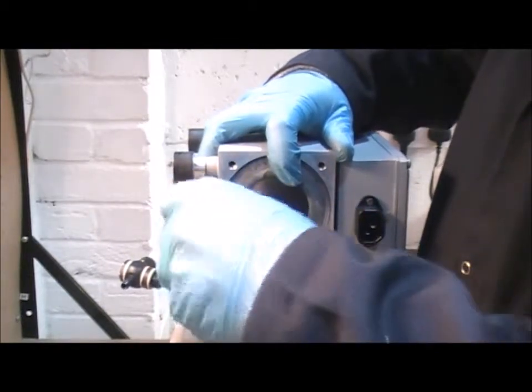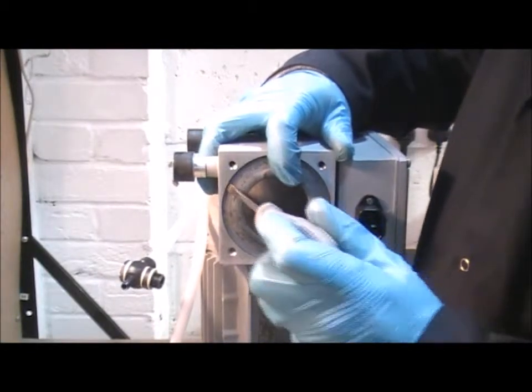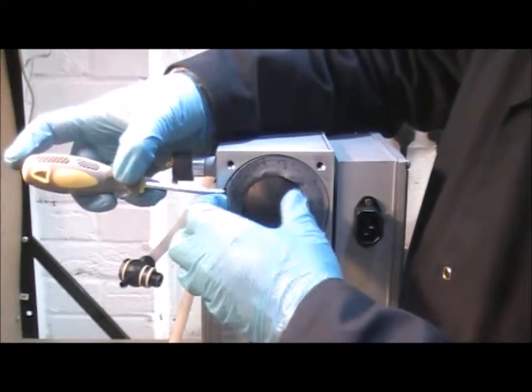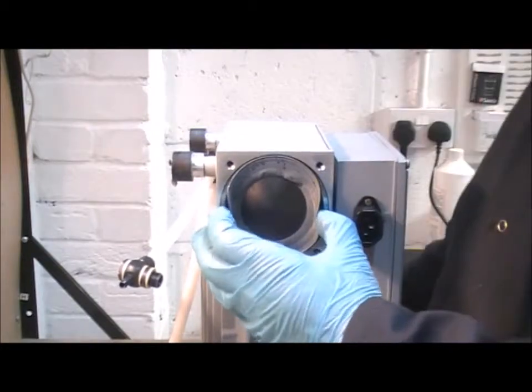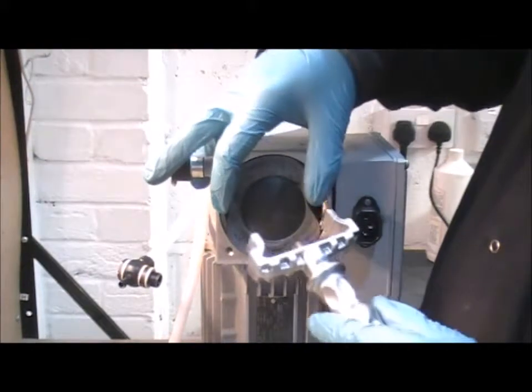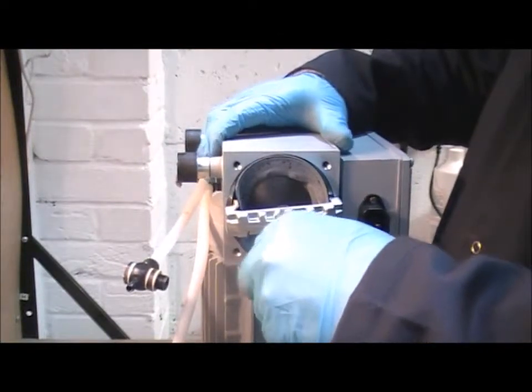You get the blade of the screwdriver down behind the edge of the diaphragm, and you should be able to just pop it up like that. And once I've got that side of it, I'm going to hold on to it and then move the screwdriver around so I can release the other side. And then hold on to those two sides and bring the tool up so that it locates in behind those two sides of the diaphragm.